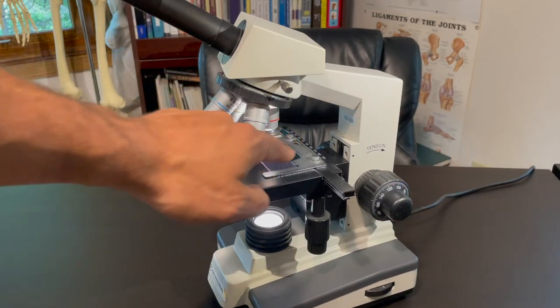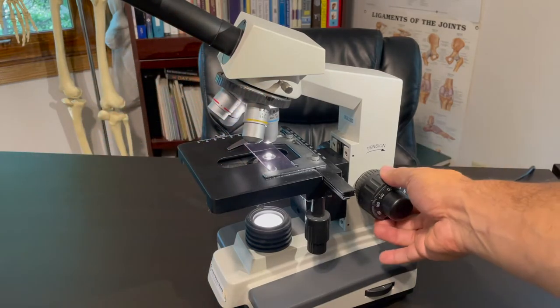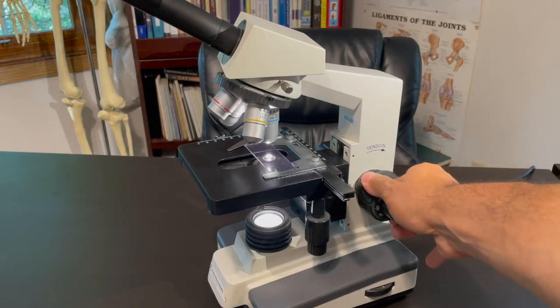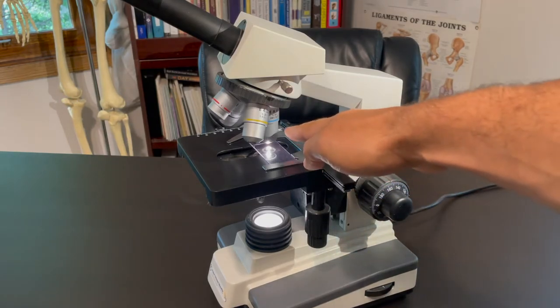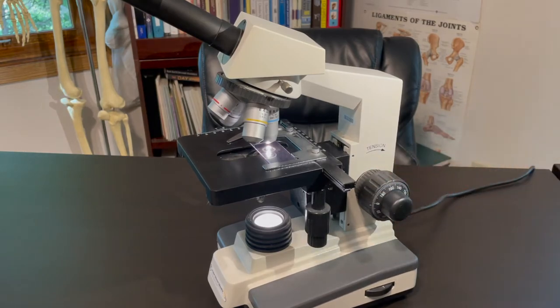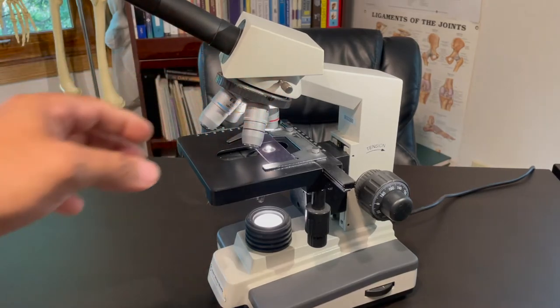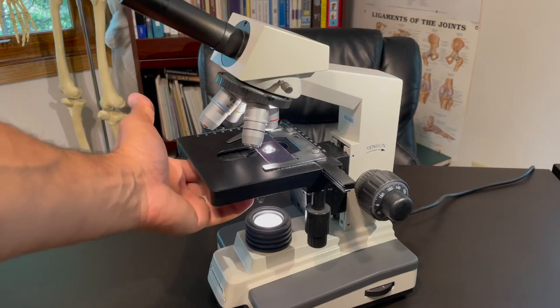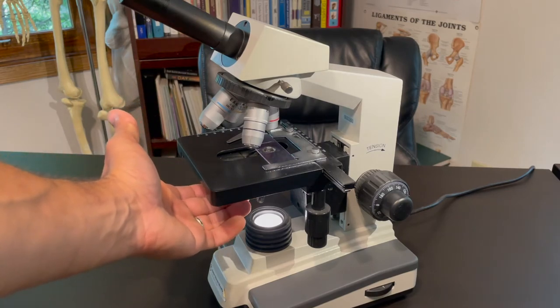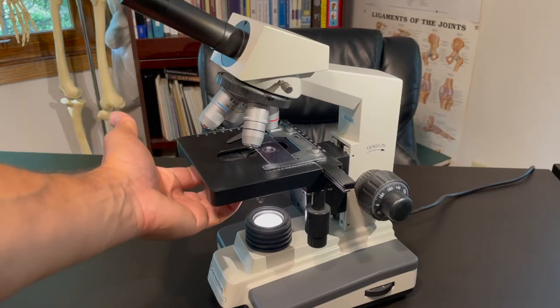A little trick that I've learned over the years is, if you want to know approximately where should the stage be, because there's a lot of play here. Well, if you turn it to the blue, just temporarily, if you turn it to the blue and you bring your stage up, not quite so that it's touching, the objective lens is touching the slide, but close. That's approximately where the stage is going to be when it's in focus. Then you can move it to the red, use the coarse again to get it. Of course, now you'll look through the eyepiece to actually see the image. You may have to use the diaphragm and condenser here. You spin this, you can actually see how more light will shine or less light will shine.